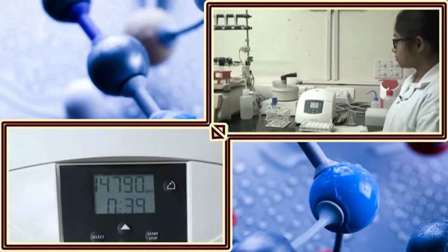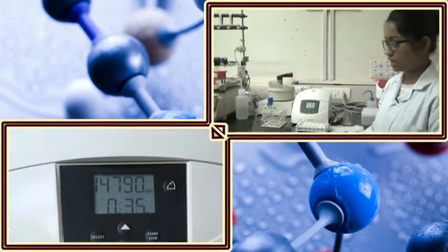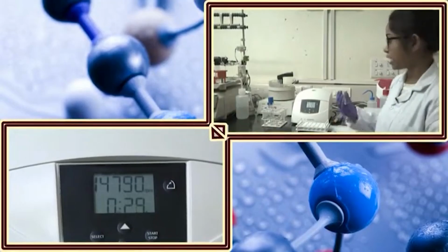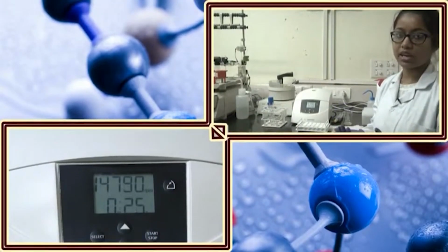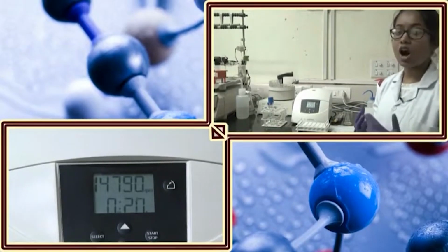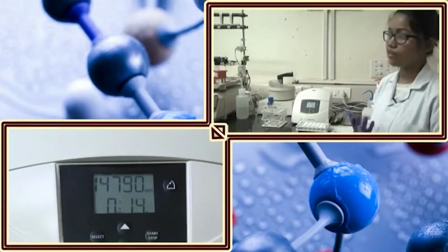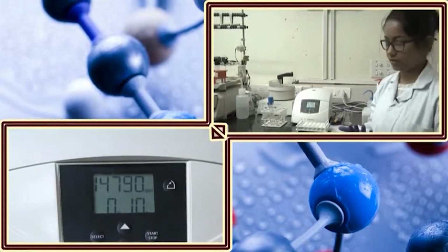So, as I was mentioning, the copy number varies in different bacterial strains. If you feel like the yield of the plasmid extraction is low, then you can go for a higher volume. Suppose here I have given 7 ml of culture, then you can give 10 or 15 ml culture to get higher yield. You should check the copy number of the bacteria as well, like how many plasmids are present in one bacterial strain. In normal cases the DH5 alpha have around 10 to 15, or hundreds, even hundreds or more than hundreds as well.